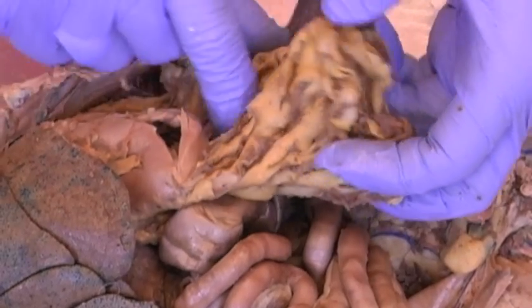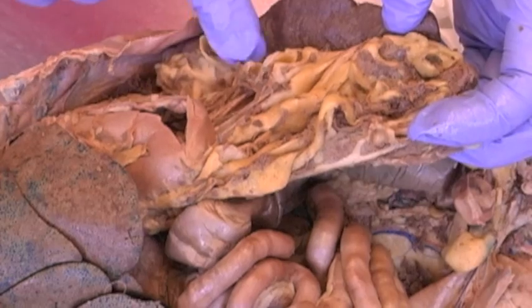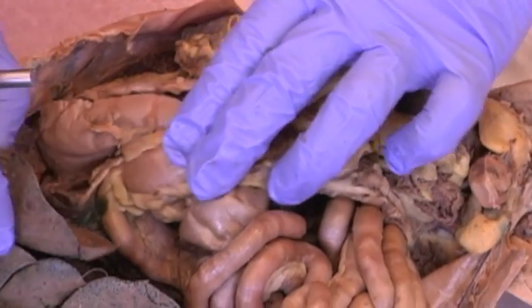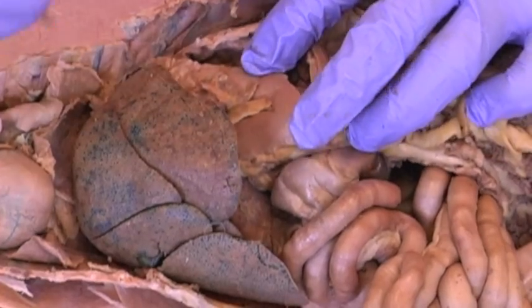The large membranes hanging off of the greater curvature of the stomach, the outside portion, is the greater curvature of the stomach. We have the greater omentum, this large, impressive membrane and a bag of fat where we store fat. And then in the lesser curvature of the stomach, we have the lesser omentum.